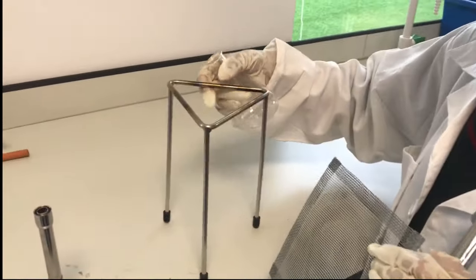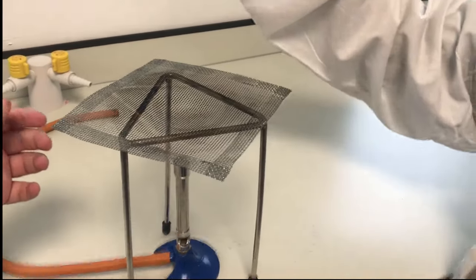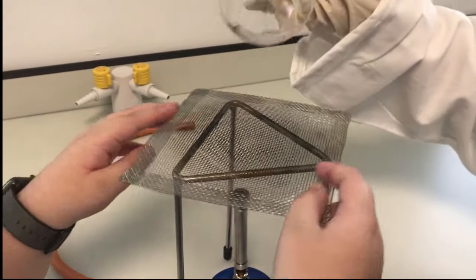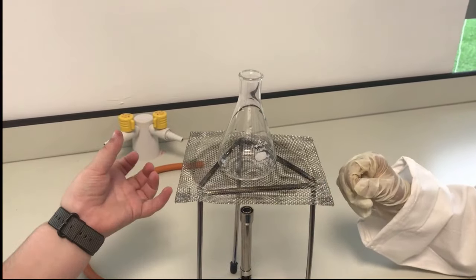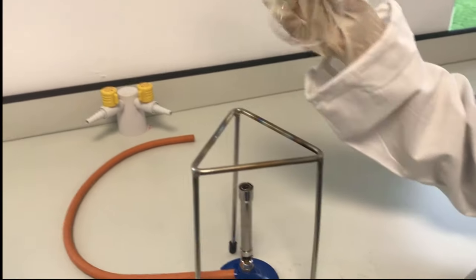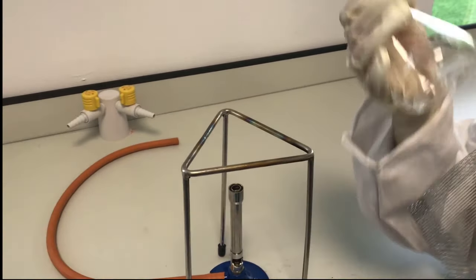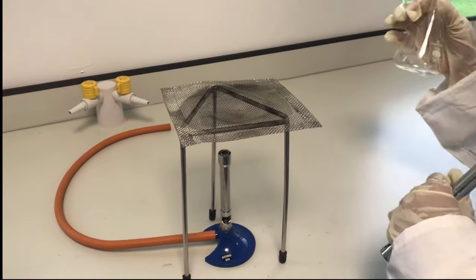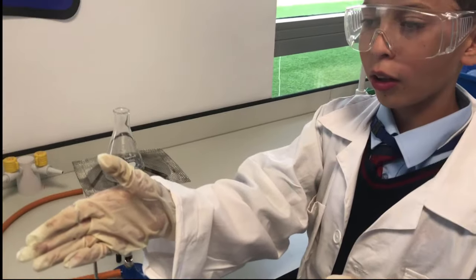Yeah, how do you use a Bunsen burner? What is this? Okay, so this is a tripod. The tripod is to hold over the Bunsen burner. The thing and the metal thing is, we don't know the answer. You put this up here and this you go here and the Bunsen burner heats it. So let's say if we don't have this, this will fall as you can see and it might damage. This glass is very sensitive so you really need to be careful.